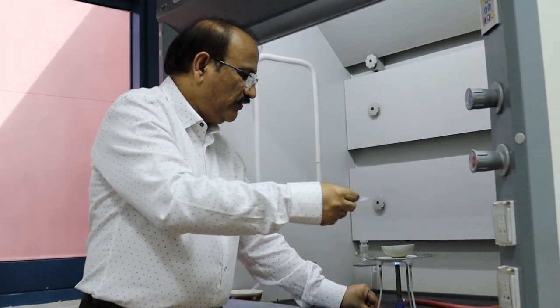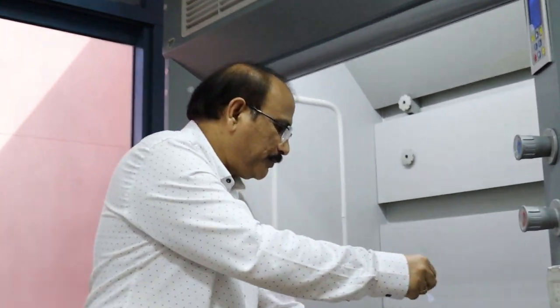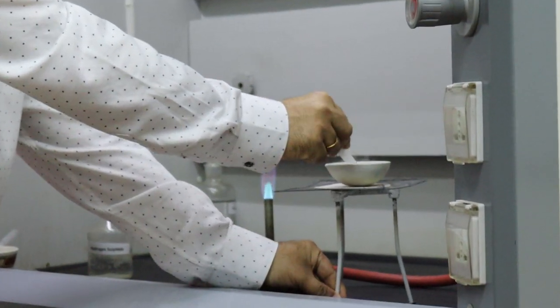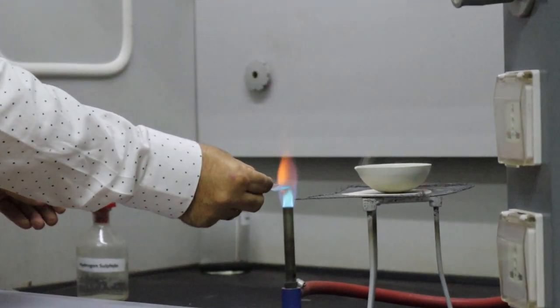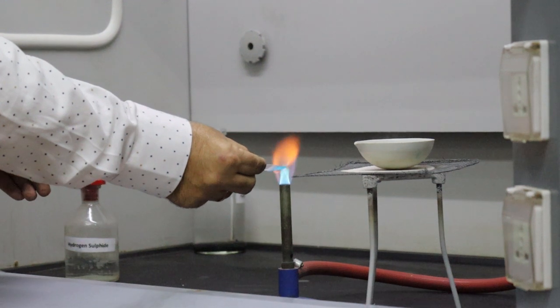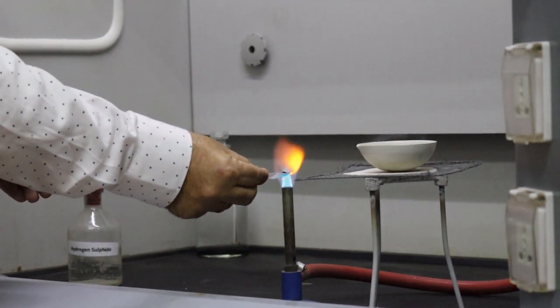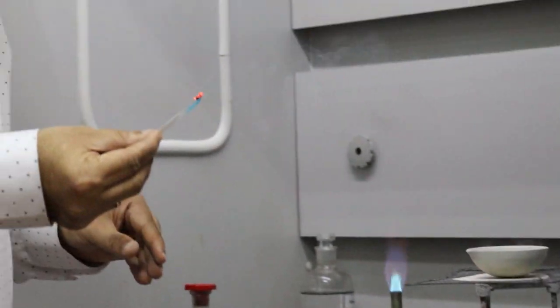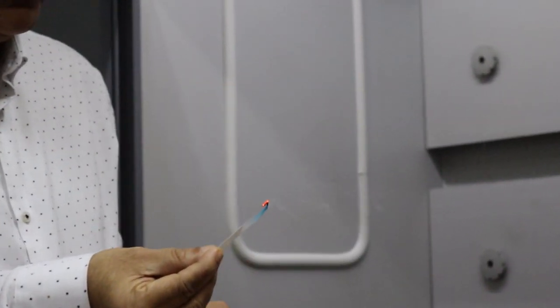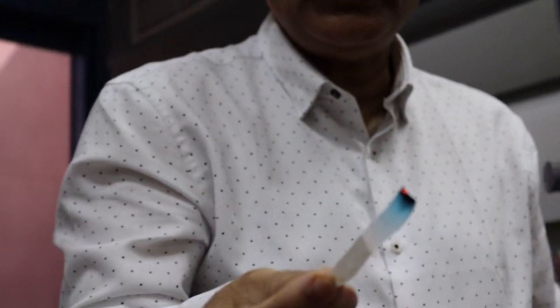Okay students, we will dip a strip of filter paper into the boiling solution and then I will burn it. So let us see what will happen. We are going to check the color of the ash. The ash is ready now. We will see blue ash.